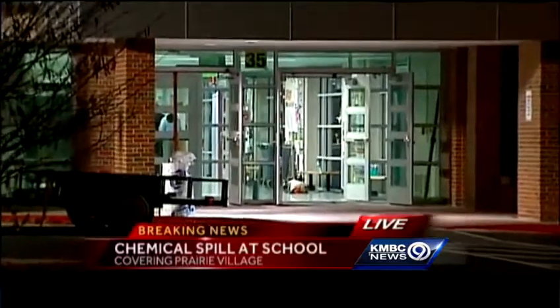Yes, good evening. There's still a lot of activity here outside of Shawnee Mission East High School. As you can see behind me, Johnson County and Overland Park safety officials are still here. And they got the trailer out in front of the school here. And what we are waiting on is for these safety officials to get this refrigerator with this chemical loaded onto this trailer and then get this chemical safely out of here.